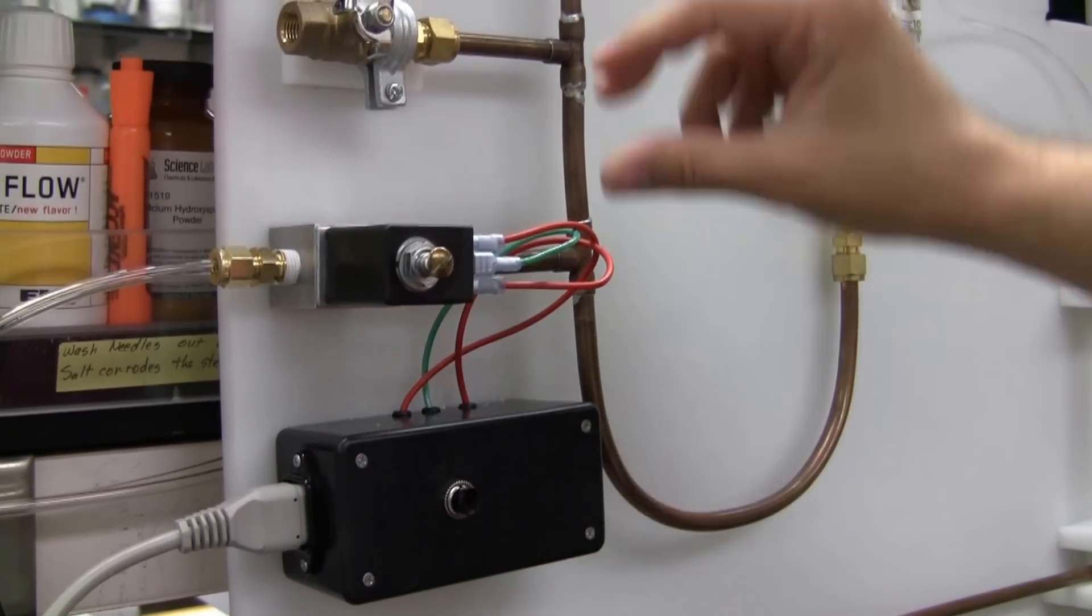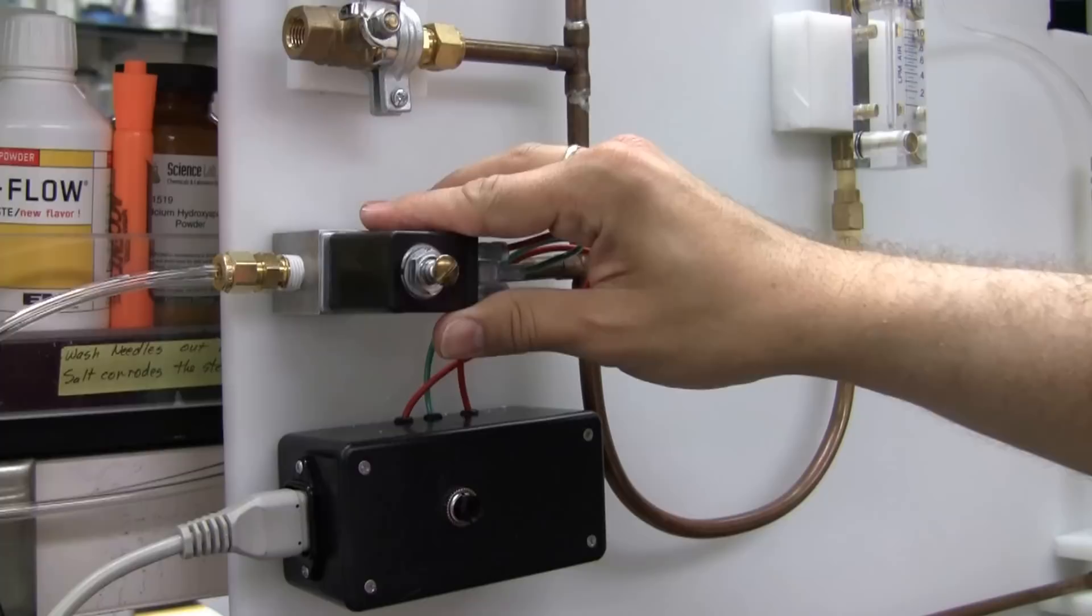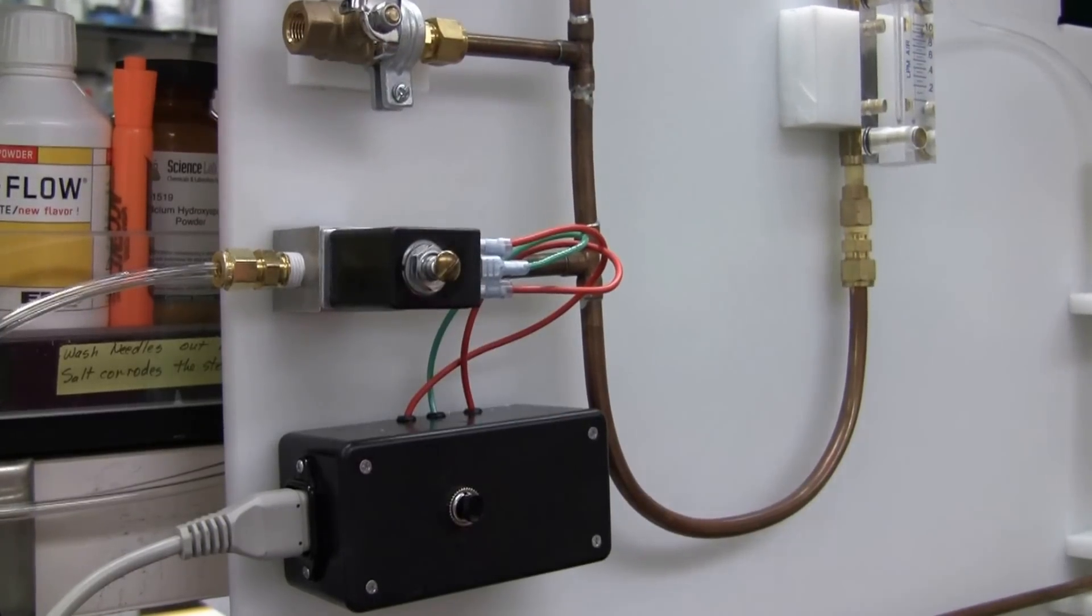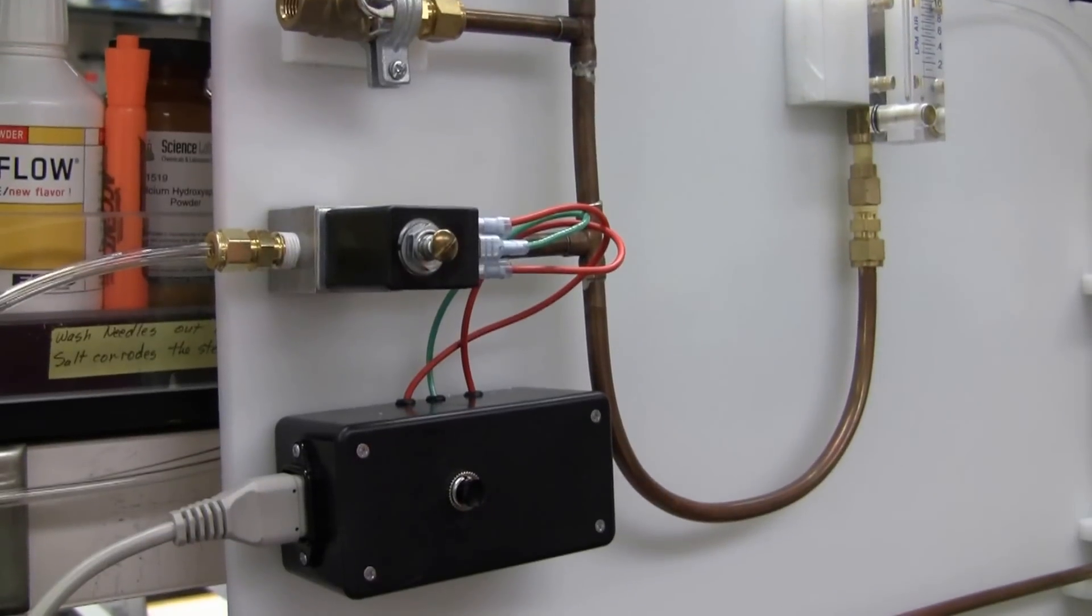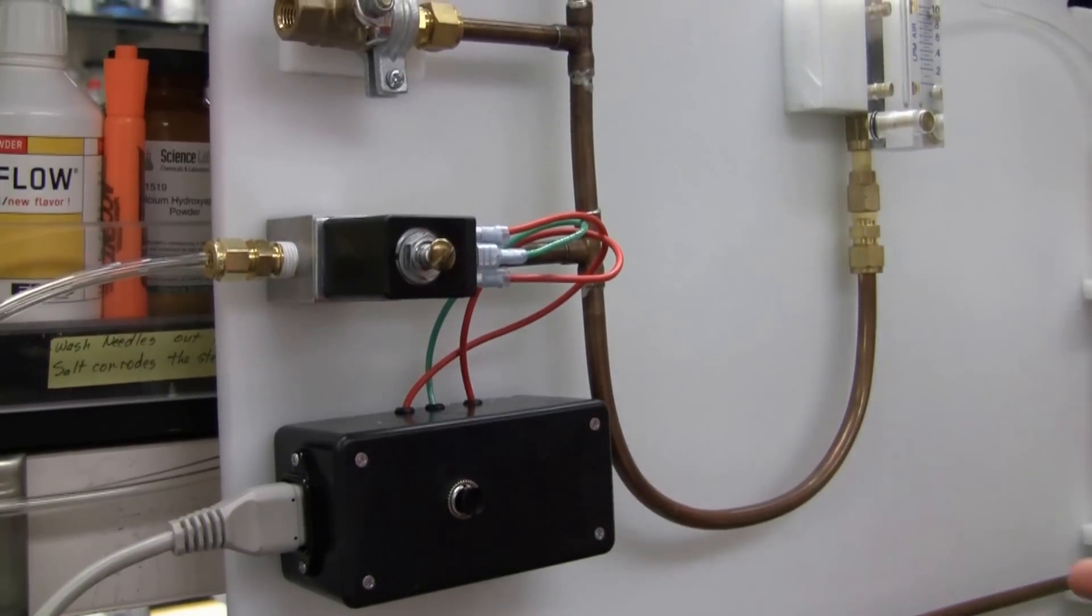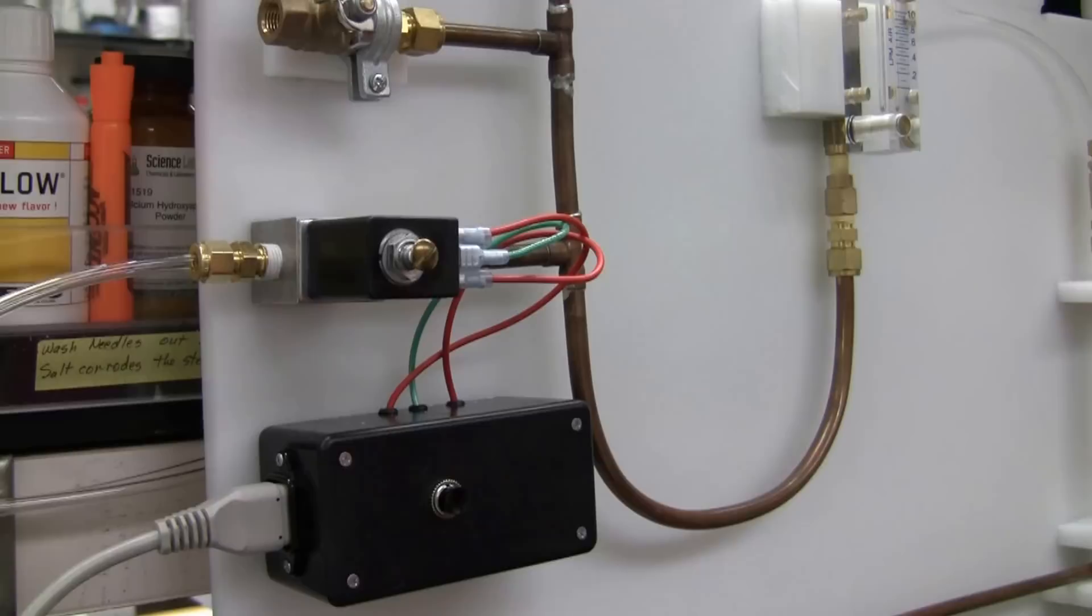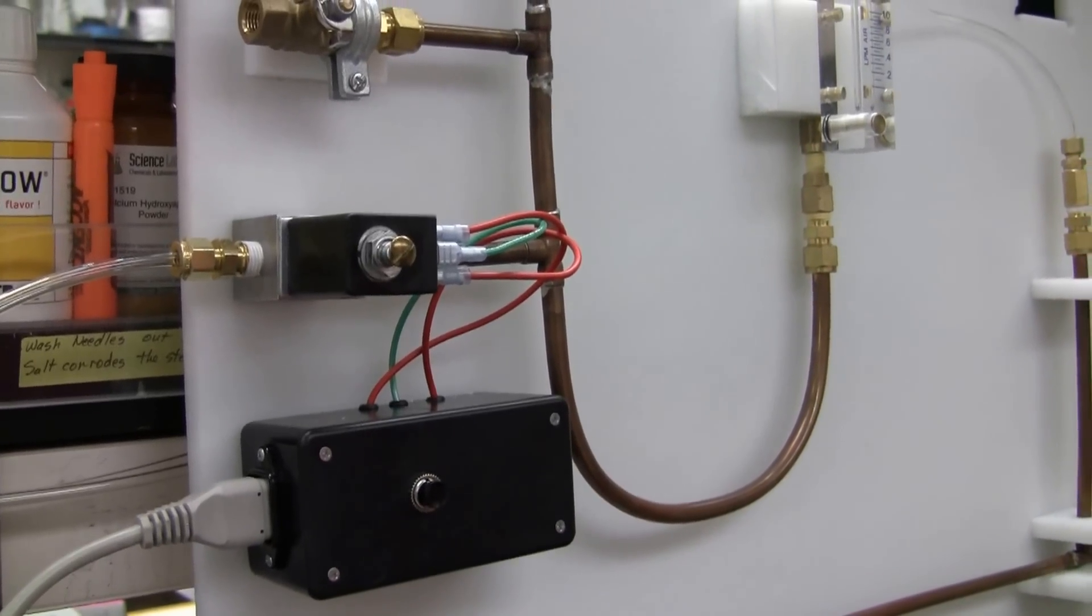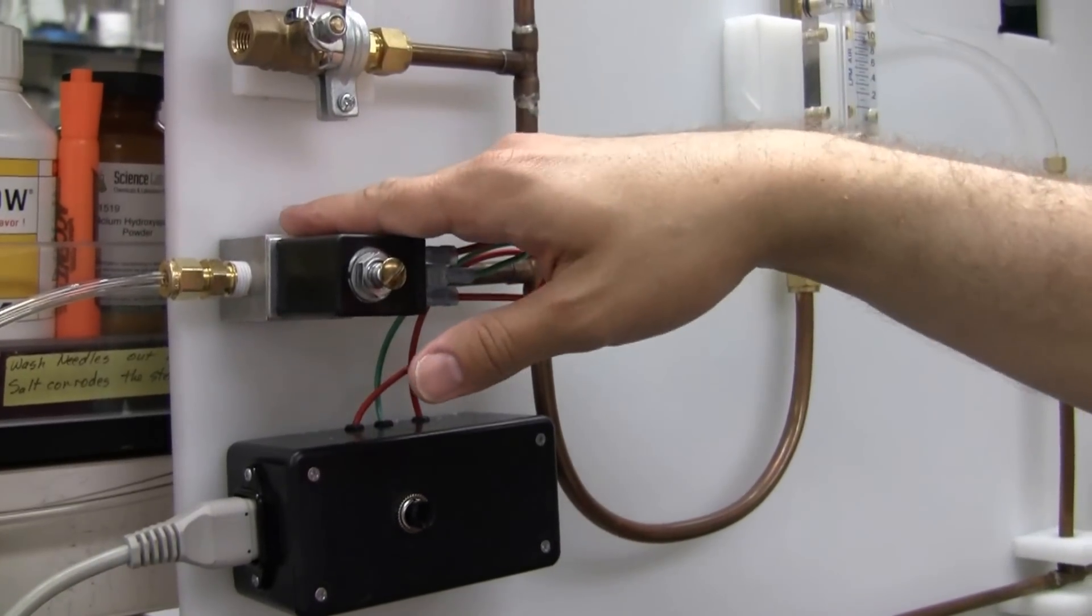It's a piece of electronics here that operates a solenoid valve. It will keep the valve open for 25 minutes approximately in case if you forgot to turn off your flammable gas that is going into your laboratory, it will shut it off right here.